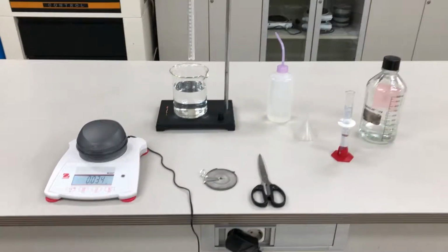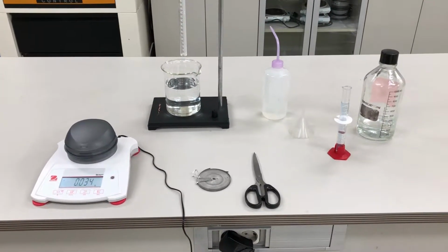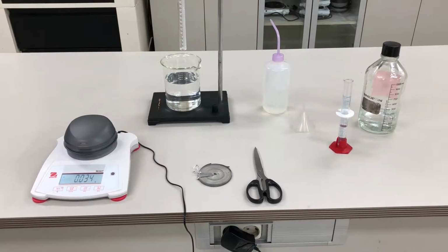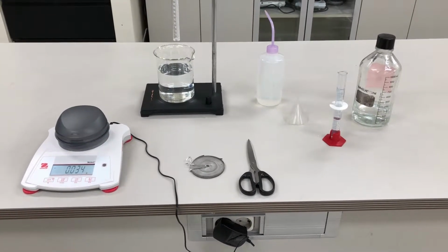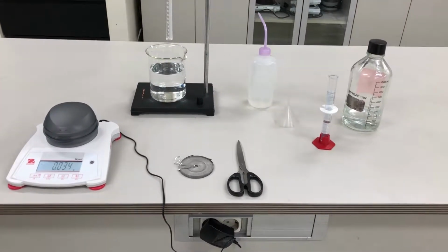This is the determination of the universal gas constant, capital R. This was filmed on October 23rd, and this is for kids that missed or anybody that just wants to rewatch the setup. So here's the setup.